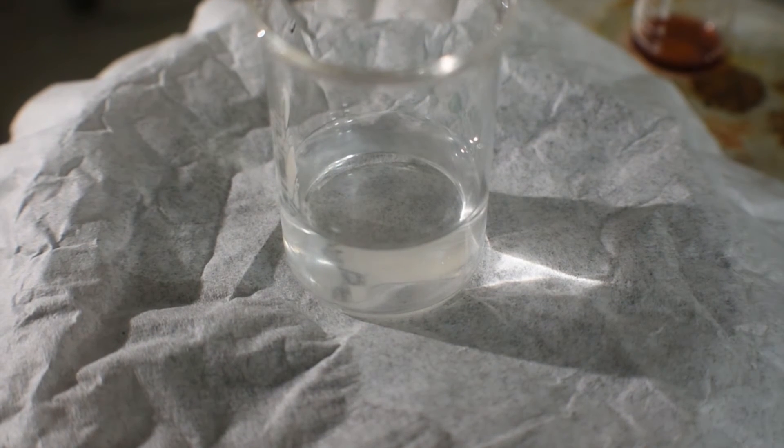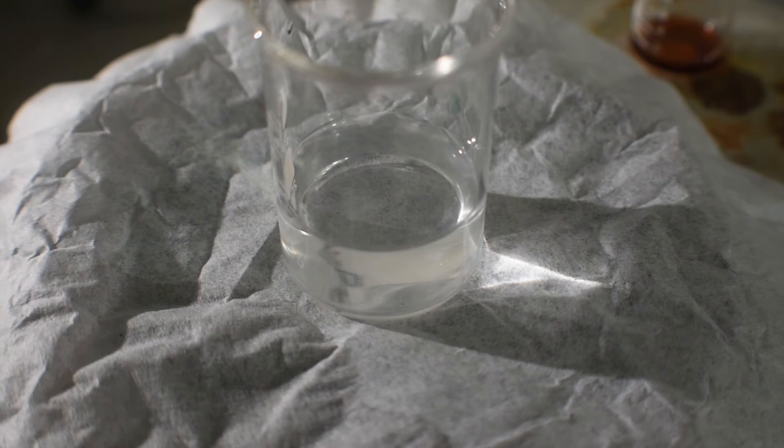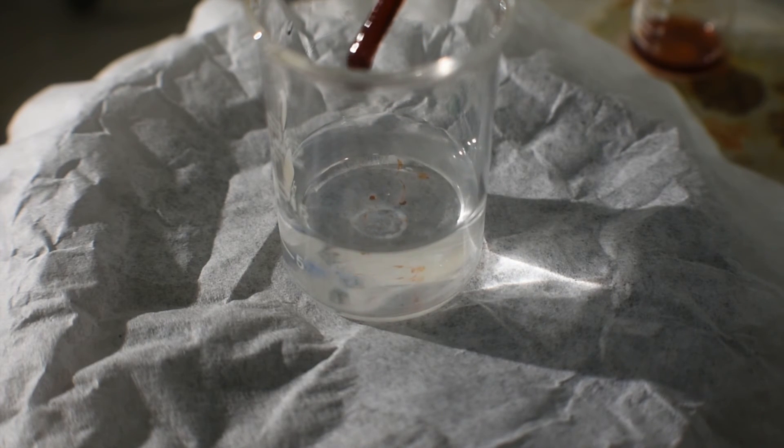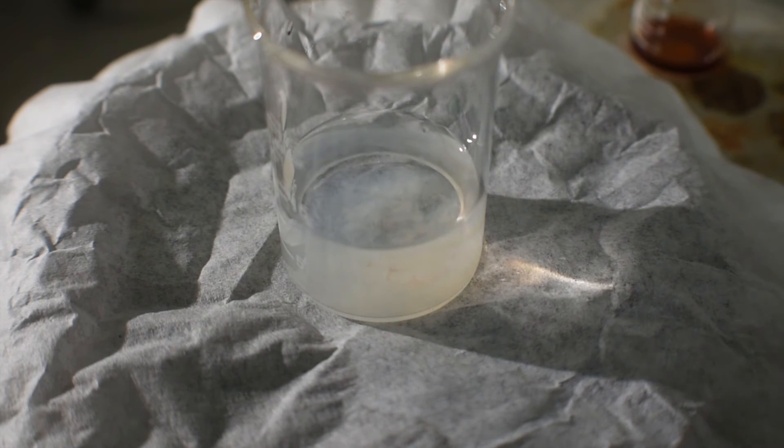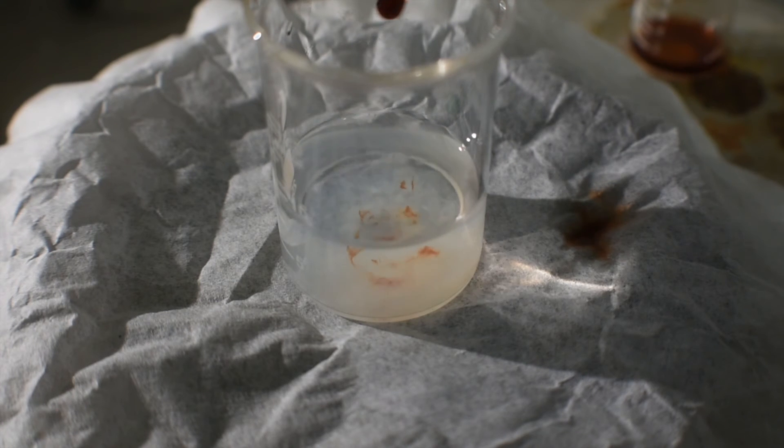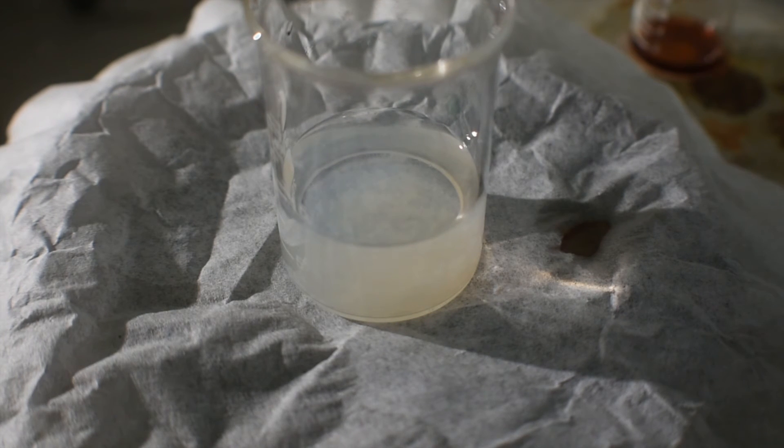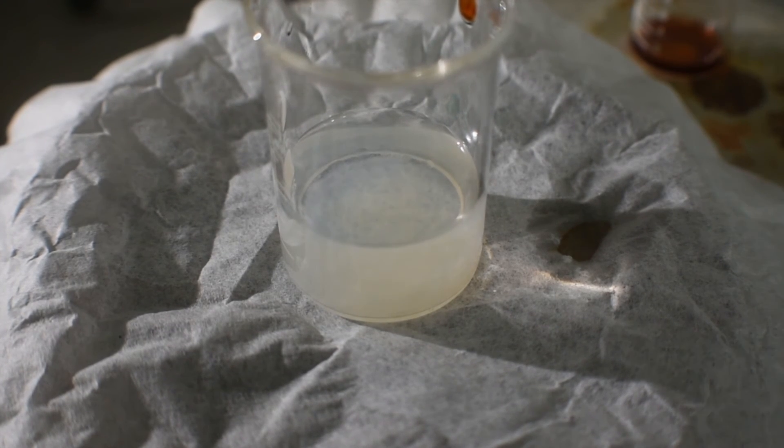Here, I have some ice-cold 35% hydrogen peroxide, to which I'm going to add some of the nickel(I) solution. Immediate discoloration and the formation of a white precipitate can be seen. This white precipitate has a possibility of being either nickel(II) cyanide, cyanate, or something different entirely. We are left with a small amount of white precipitate and a completely colorless solution.